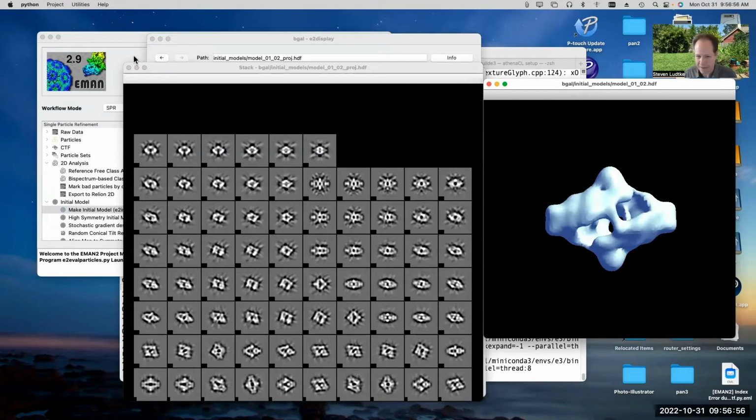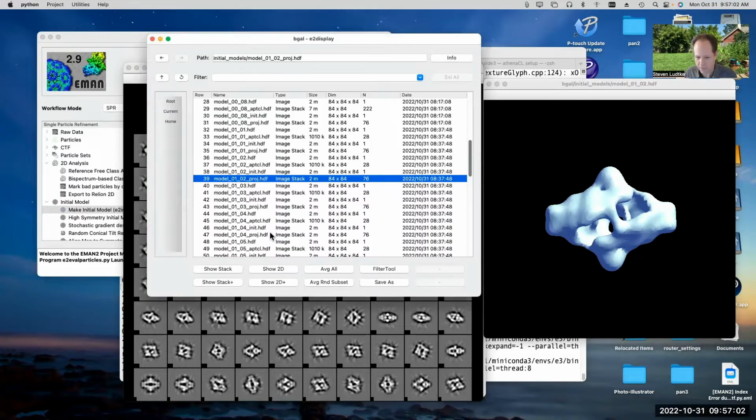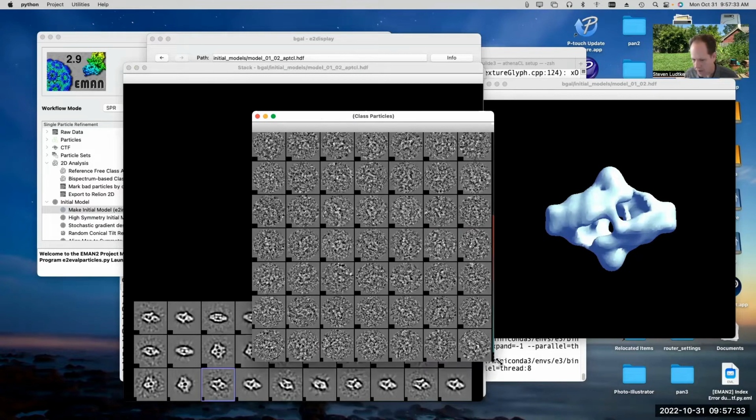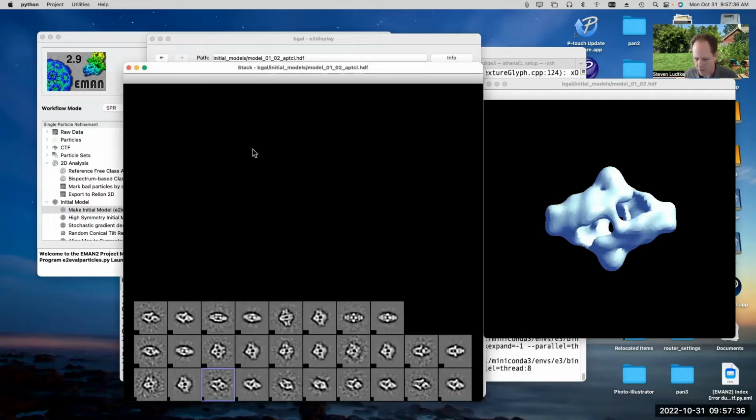You can't necessarily. If you don't know anything about what your particle looks like, it can be very difficult to judge. If you look at the A particle file and you find significant disagreements, if you have a class average which looks good and you have a corresponding projection which doesn't look like the class average in some significant way, even in 1 or 2 cases, that's usually a bad sign. Now, if the class average that you're comparing to doesn't look very good, if it looks really noisy and like it jumbled a bunch of stuff together, then you could look at the particles that made up that class average, and you could say, oh, was it really including particles that all looked similar to each other or not? You can ask more detailed questions.